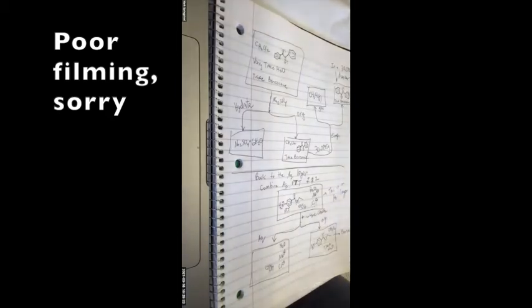Okay, so let's do it. I'm gonna combine these two. I think this is a good idea. I think it's gonna fit. Oh, it's kind of heavy. Yeah, it's gonna be fine. Yeah, it's kind of full though, huh? So I've got these combined two layers. I know it's not really noticeable, this precipitate, but there is a precipitate in there, and there's some methylene chloride already in there dissolving some of the precipitate for us.